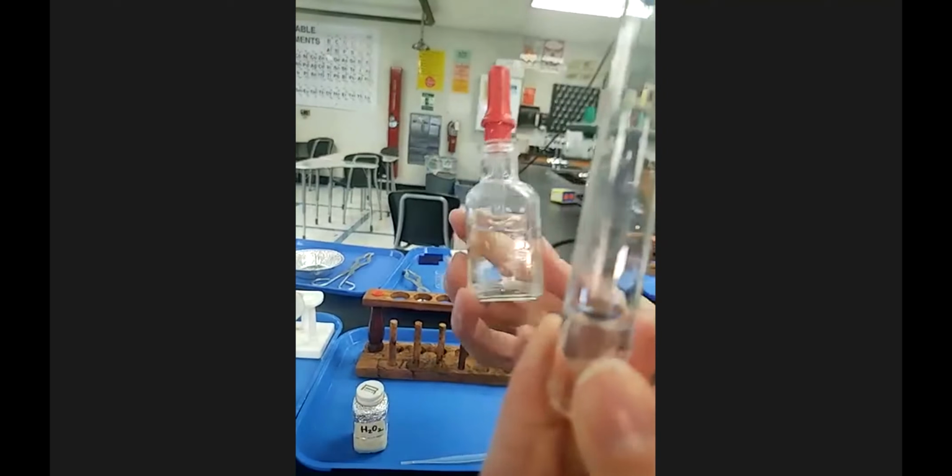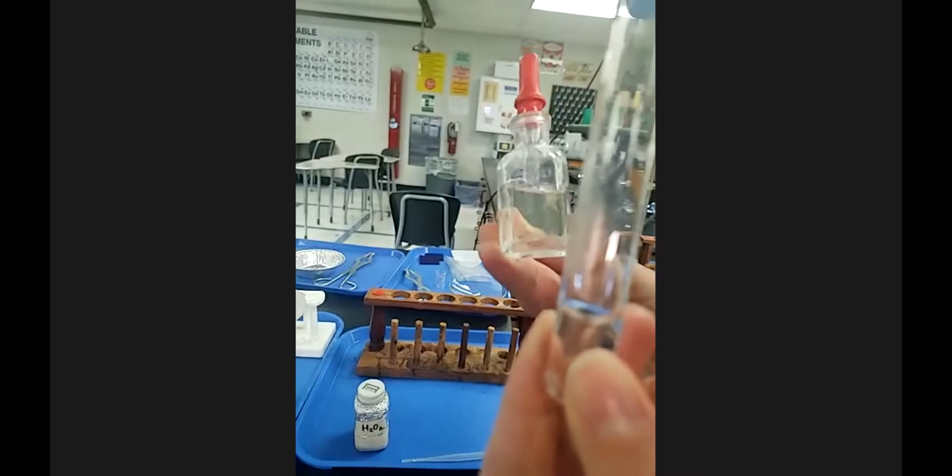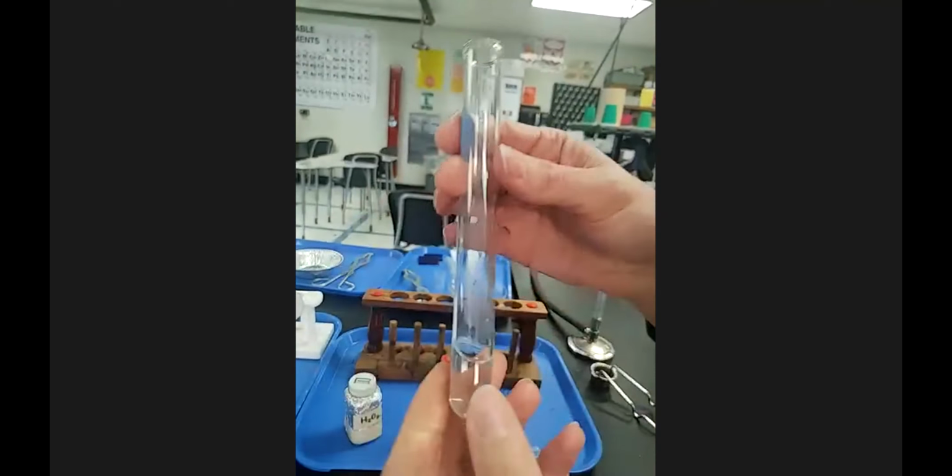Here is some hydrogen peroxide. I am going to add bleach here, which is sodium hypochlorite. That's the active ingredient in bleach. Oh, the hydrogen peroxide odor-wise, let me see here. It does not have a distinct odor. I'm not smelling anything super dramatic.